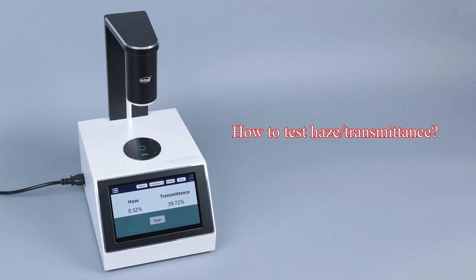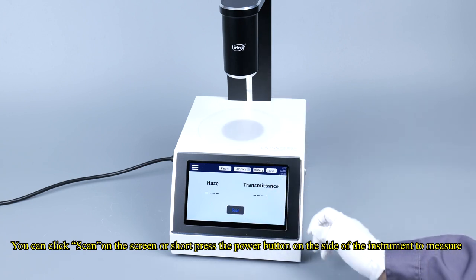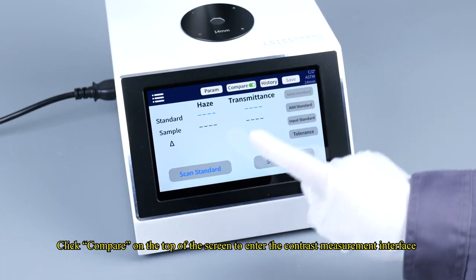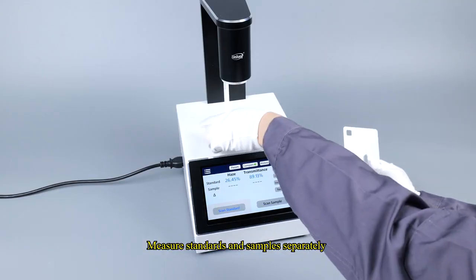How to test haze/transmittance? The instrument enters the haze/transmittance measurement interface by default. You can click Scan on the screen or short press the power button on the side of the instrument to measure. Click Compare on the top of the screen to enter the contrast measurement interface. Measure standards and samples separately.